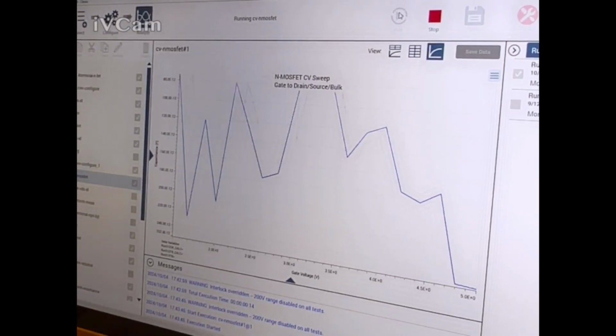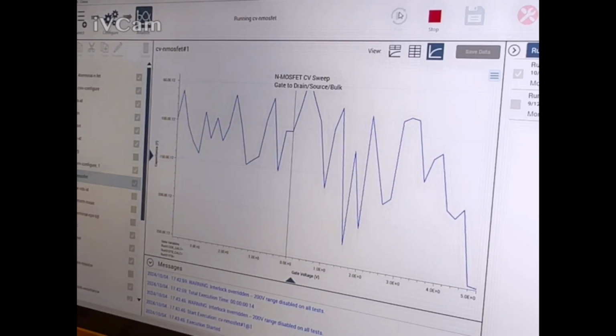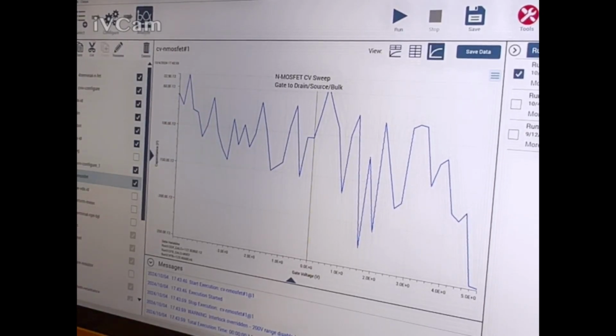Oh, it's not going to short though because I don't have the cable. But it shouldn't matter. I might need a fourth cable. Or can you short them in the software? Would that fix it? It should be doing that, but why is it not working? Gate, drain. Gate is high. Something's not working right here. Oh, I don't have anything in the gate. Duh. This is the gate. Yeah, I moved the wrong cable.